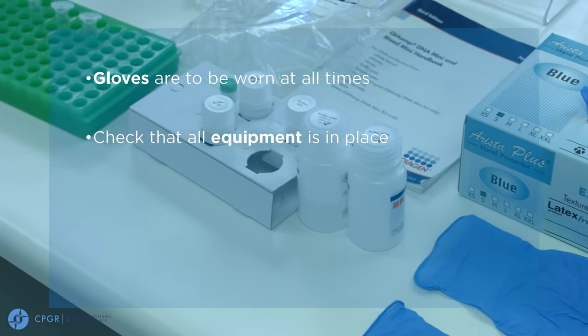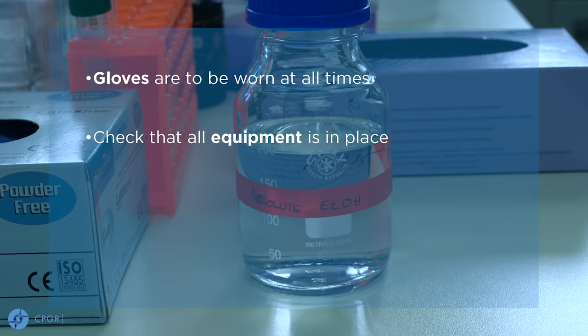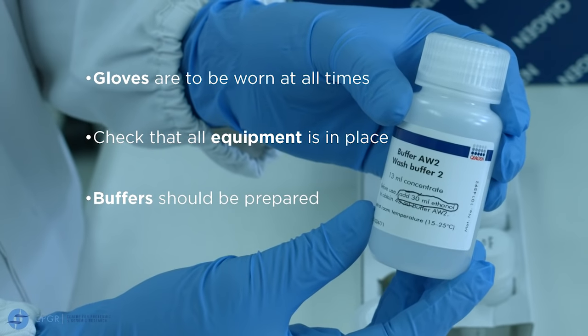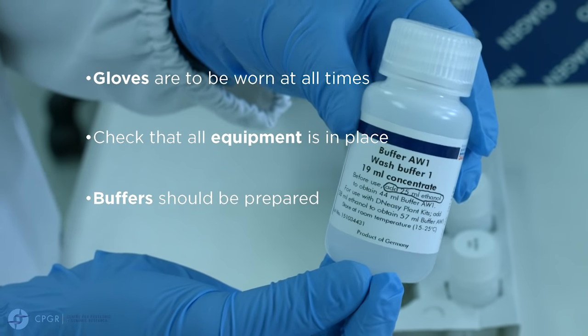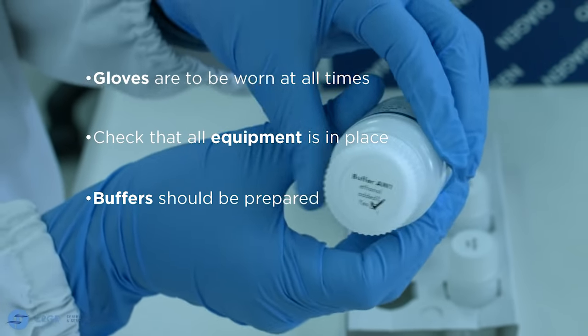Also check that all equipment and consumables you are going to use are in place and that the buffers in the kit have been prepared. For example, the appropriate volumes of ethanol have been added to buffers AW1 and AW2.